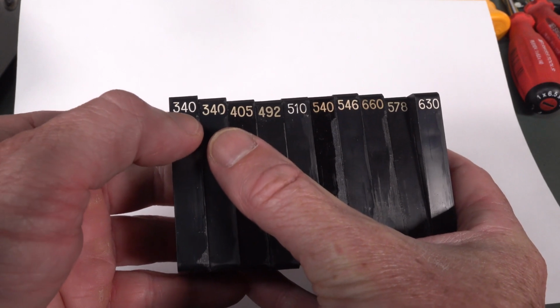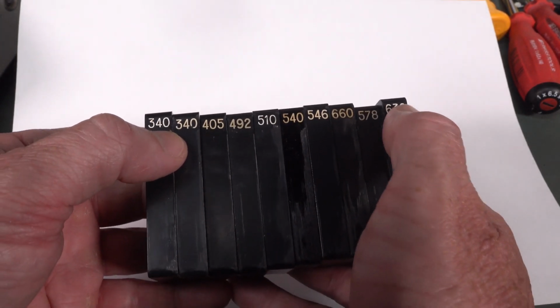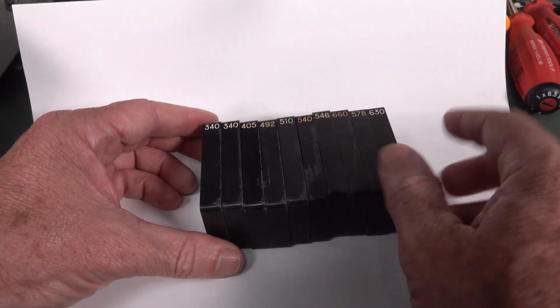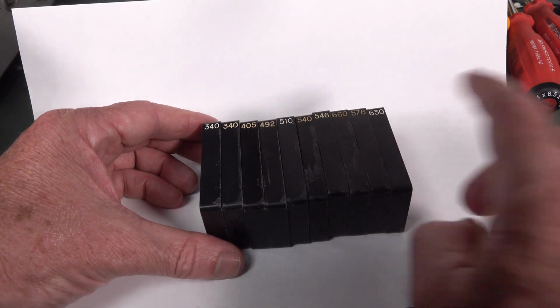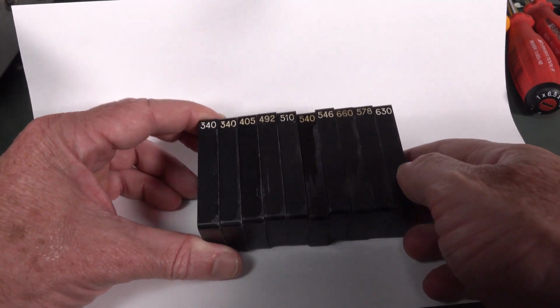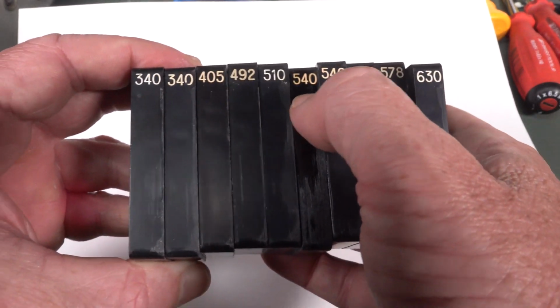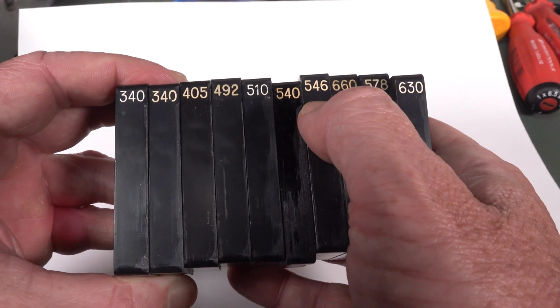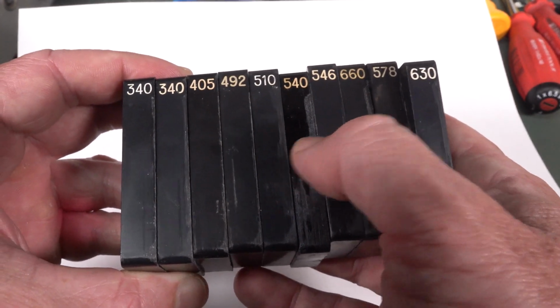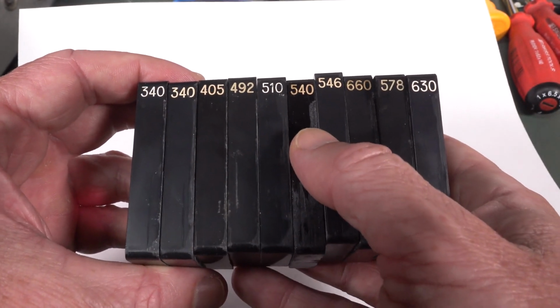These are the filter frequencies in nanometers, of course, 340 nanometers up to 630, and most of those are in the visible spectrum. This is going to be red up here at 630, and it just goes down the spectrum. These things must be quite narrow, because one's 540 nanometers, the other's 546. So for these to be effective in practice, they have to have a fairly narrow bandwidth, but I didn't know what that bandwidth actually is.